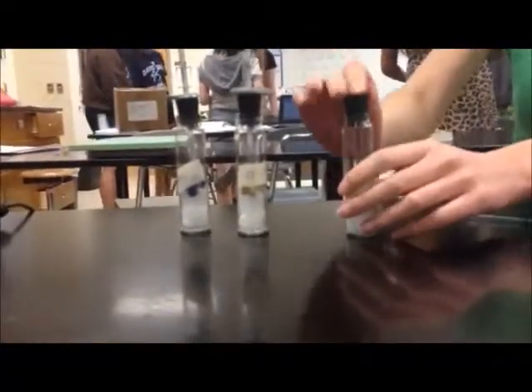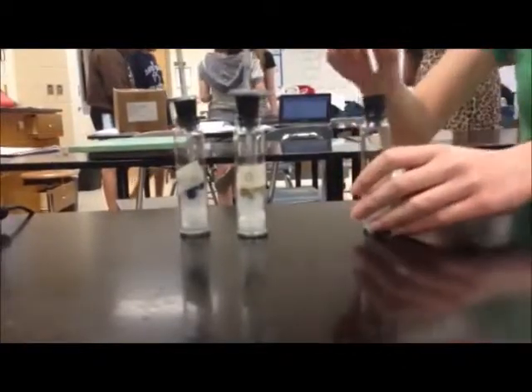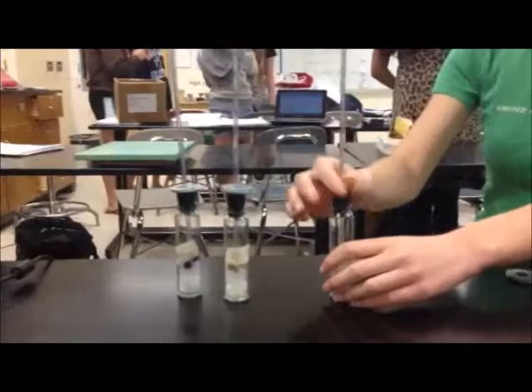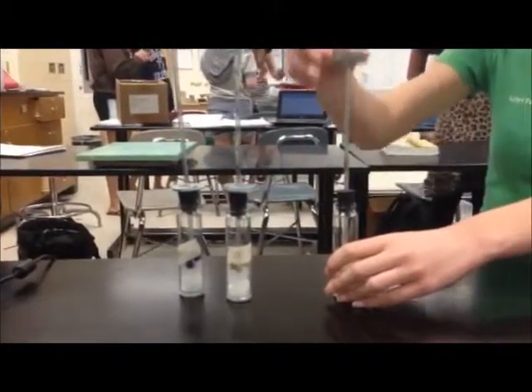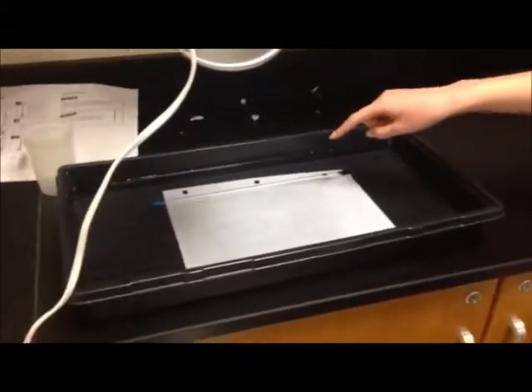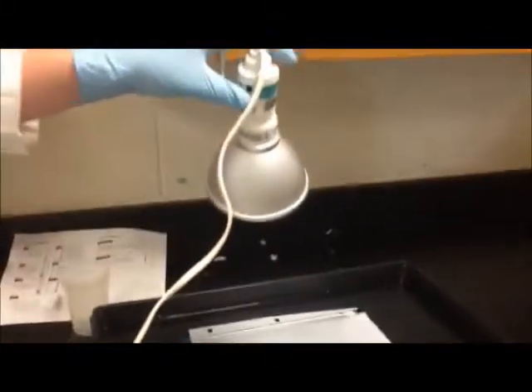We label each respirometer and place a stopper and a glass pipette into each respirometer to serve as a way to measure the respiration inside and add some washers to weigh it down while in the tub. Then in the tub we set up a lamp and a thermometer to help record data.